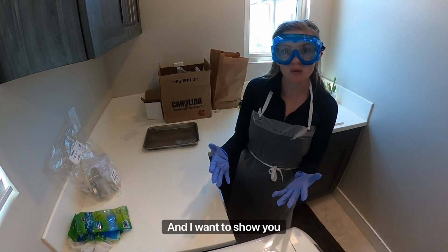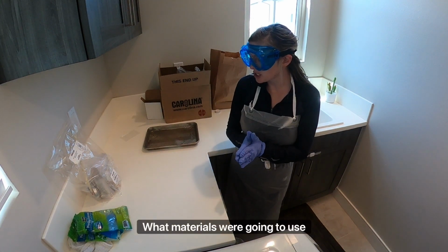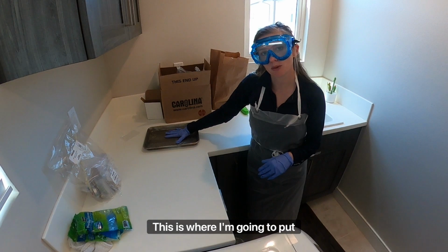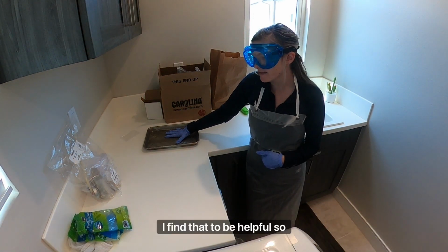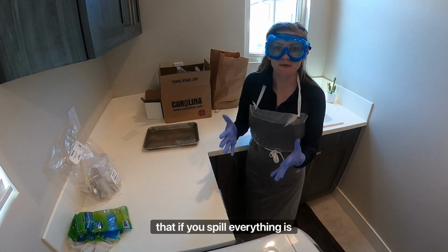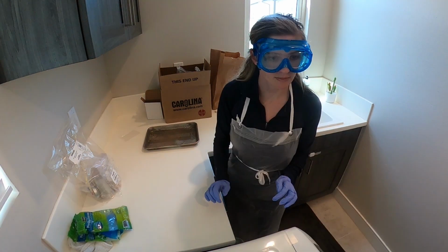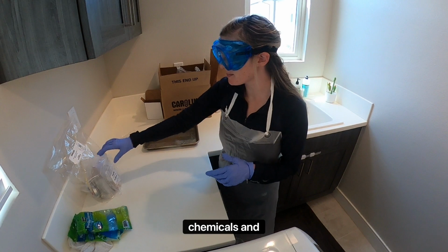And I wanna show you, again, what materials we're gonna use and where to lay it out. What you'll see is that I have a tray here. This is where I'm gonna put all of the chemicals for the lab. I find that to be helpful so that if you spill, everything is self-contained. All right, so let's pull out all of the chemicals and equipment.